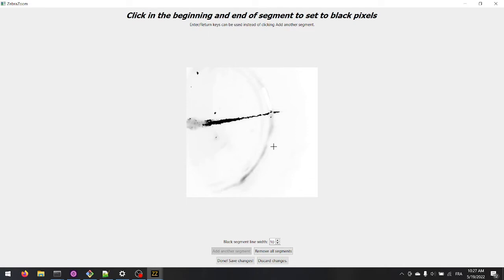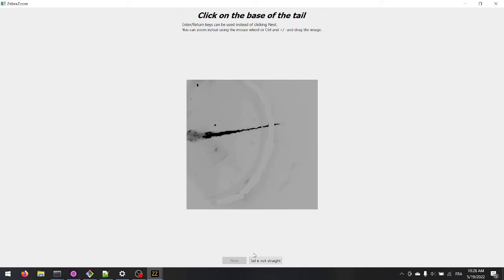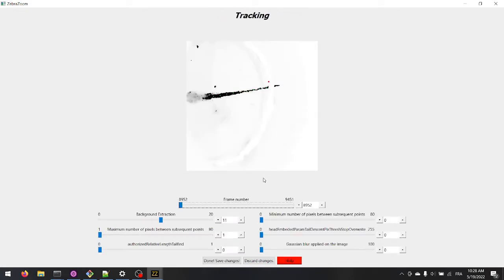When drawing the segments, make sure that the artifacts are completely covered by the segments. If tracking error remains, try adjusting the minimum and maximum number of pixels between subsequent tracking points, as the values of those two parameters are not always optimal by default.